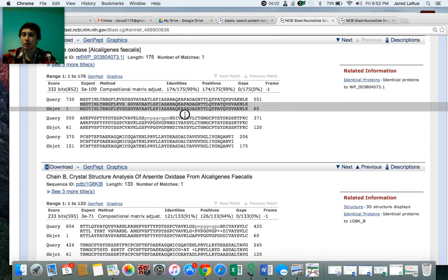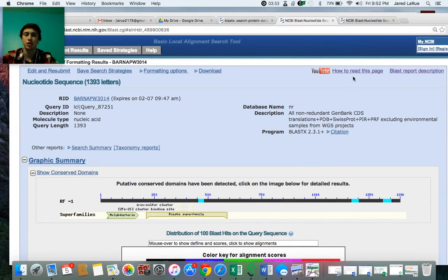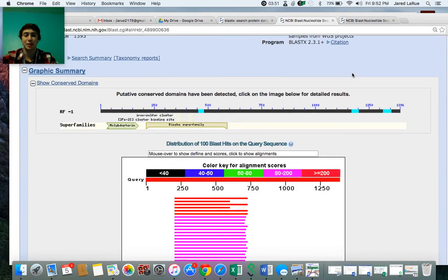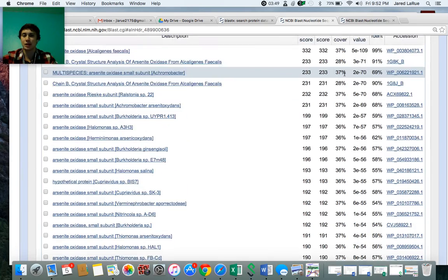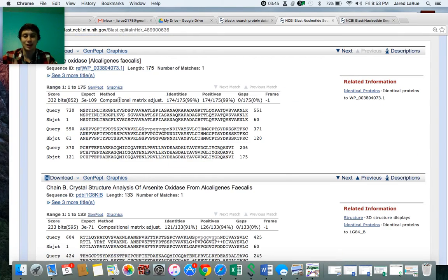Not really sure what this middle fill-in is for. I couldn't tell you. That's one thing I'm not very sure about. I'm sure you can always come here to the YouTube "how to read this page." Maybe there will be more there. I don't remember if there's anything in there. In all the times I've used it, I have no idea what it is.